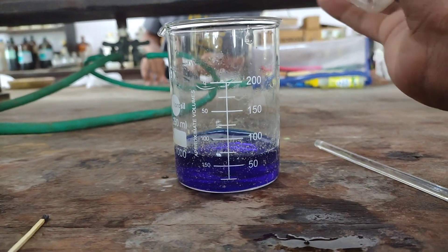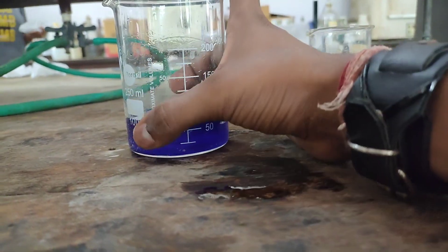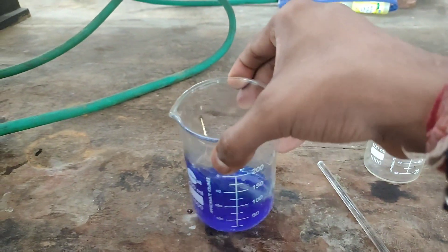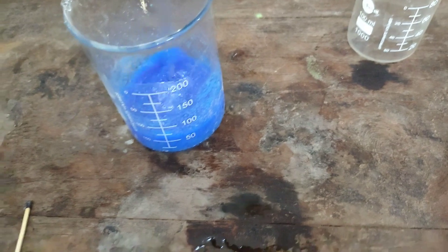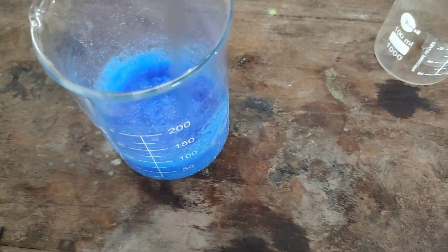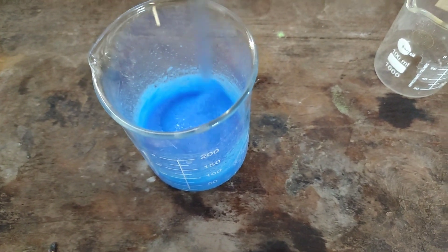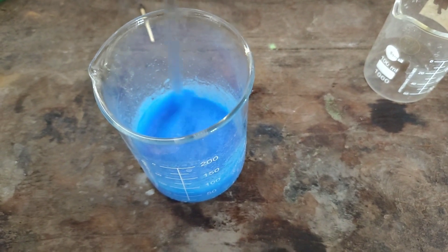You can see that the copper acetate solution has turned deep blue in color. It was then stirred with a glass rod. As the solution cooled down, the cis complex starts precipitating.